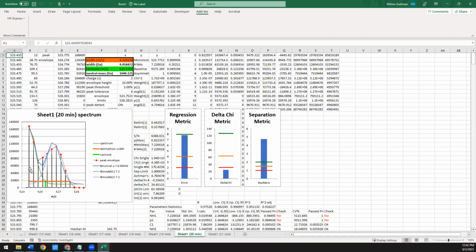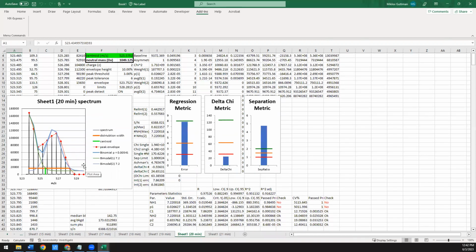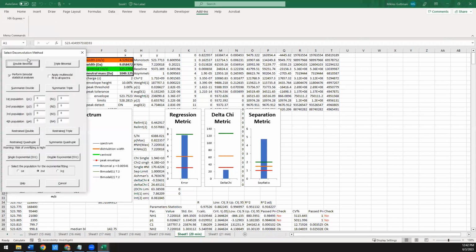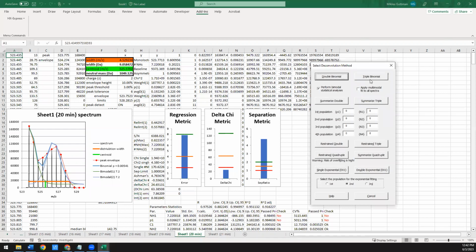Okay, so it did the double fit. The metrics don't look that great, but you can also tell by eye that the fit actually does not look that great. The distribution of the data here looks broader than it's able to fit. And it's also doing this weird thing where it's shifting the baseline up to try to fit this better. So clearly there's something else happening here. So if you come across something like this, what you could try, and there's functionality built into HXExpress, is a triple binomial.